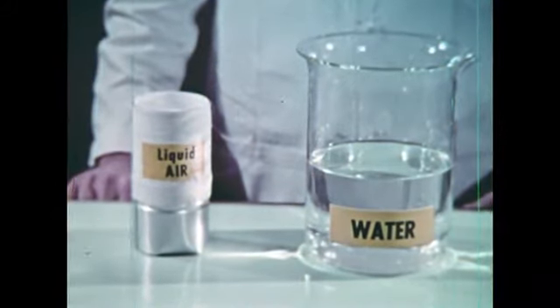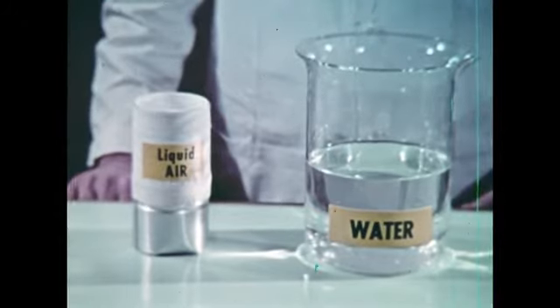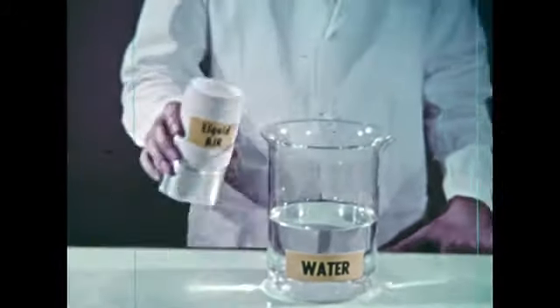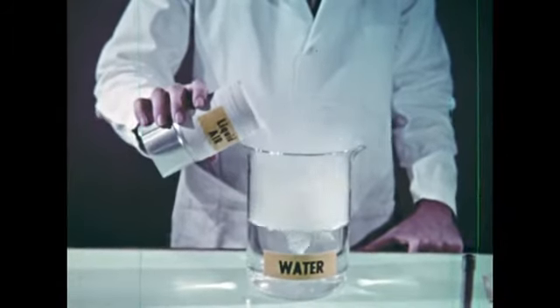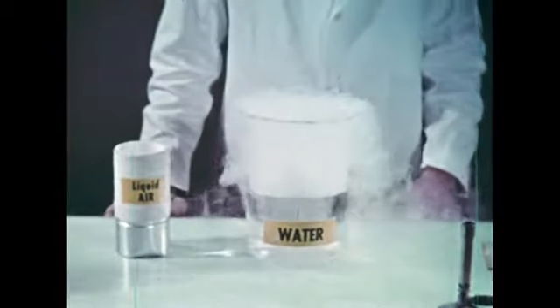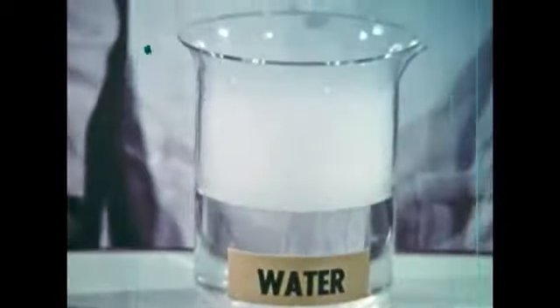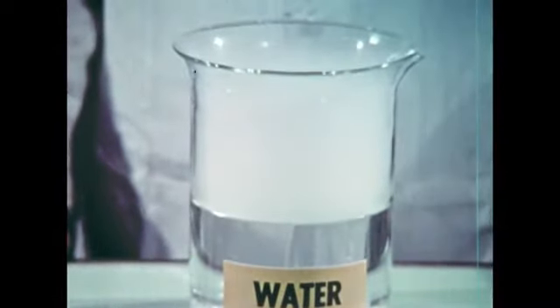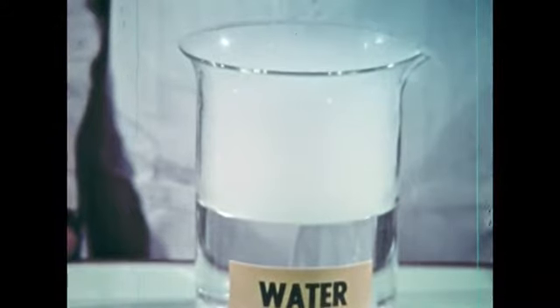The fractional distillation of liquid air method to produce oxygen depends on the different boiling points of nitrogen and oxygen. Therefore, it's also an example of physical, not chemical, change. The liquid air floats on the water and evaporates. Nitrogen boils off before the oxygen because it has the lower boiling point. The combustion test this time shows that little oxygen is present in this vapor.